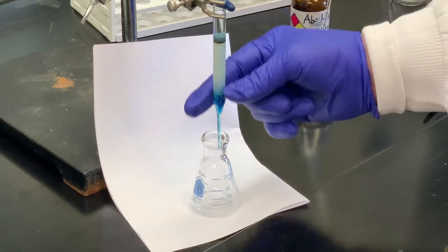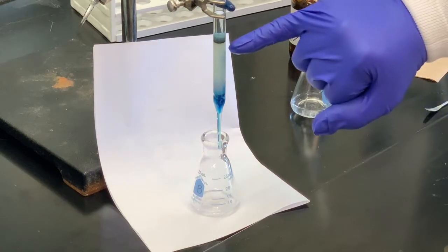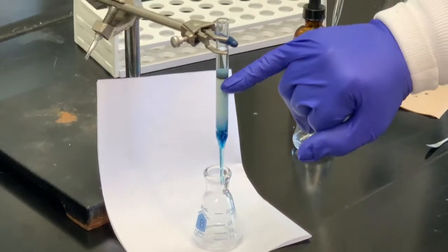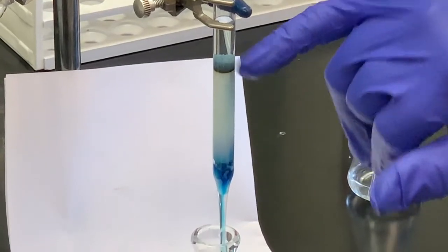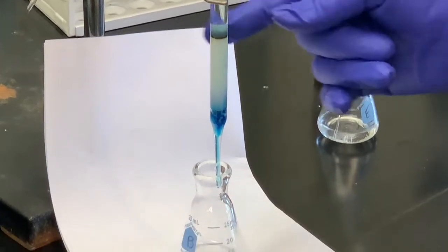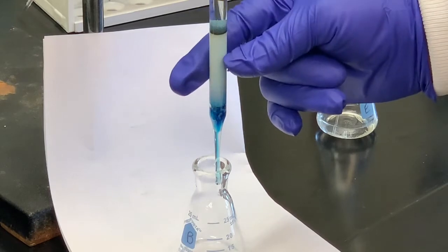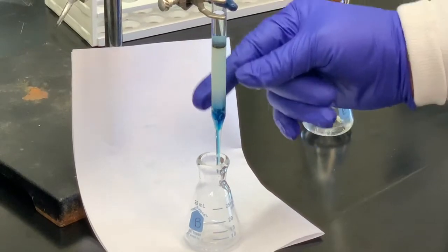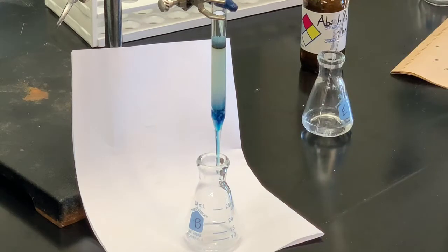We're going to let this go. I want to try to collect some of this blue material, which is the methylene blue. You may be able to see just a tint of yellow near the top — this is the fluorescein dye. So we're going to let most of the blue come out and then I'm going to change solvents. What I have in here now is ethanol, so we'll change to water, and that more polar solvent will interact with the fluorescein and start moving it down.